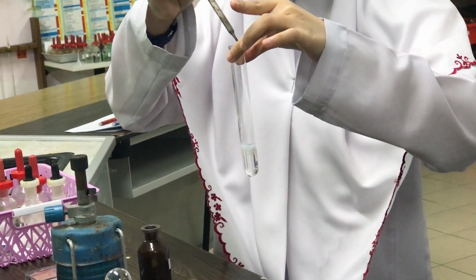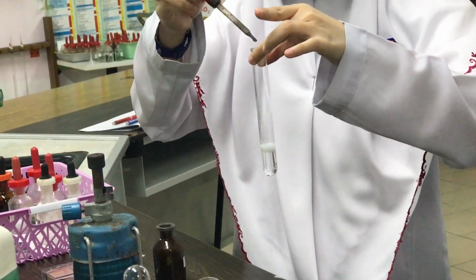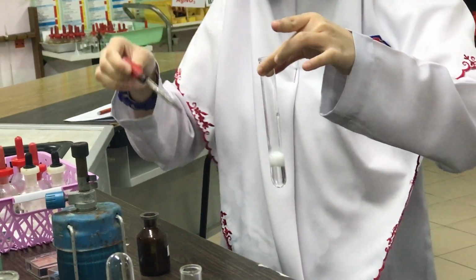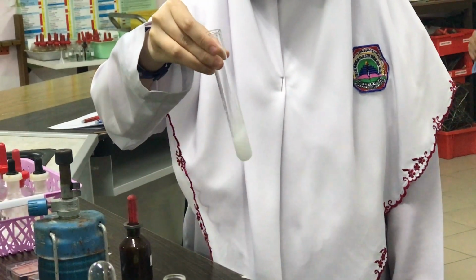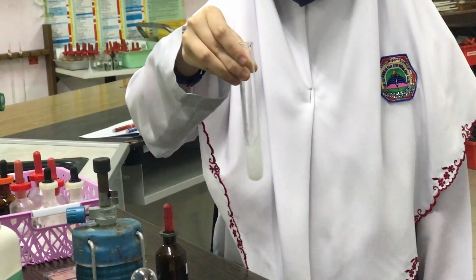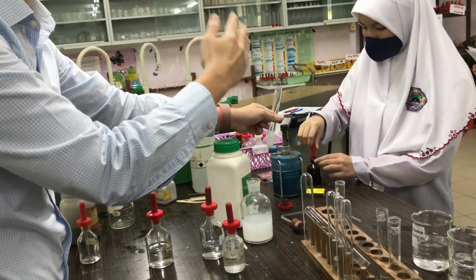What do you see? Okay? Yep, keep on dropping just for the whole lot. Yep, and then shake it. Just add the whole thing, it's fine. Okay, and then shake. Now, shake like this. Okay, what do you get? So this was chloride. What was the first thing you added? You added nitric acid first, then you add silver nitrate. Silver nitrate that she added, was it solid or solution that she added?